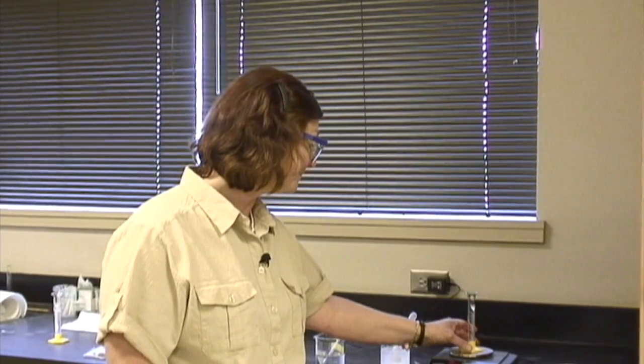Well, here we are in the lab again, and you know how excited I get? I just get so excited. And we're doing lab particles, aka colligative properties. Well, the first thing I must do is find the density of my 2 solutions. And I'm going to mass an empty graduated cylinder.